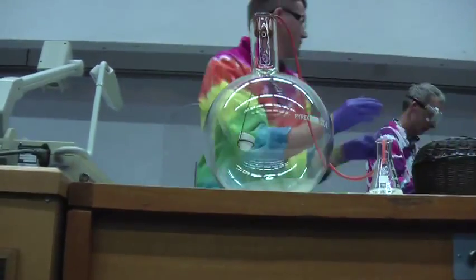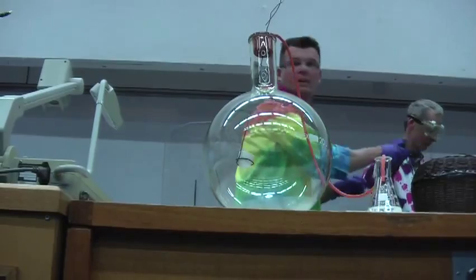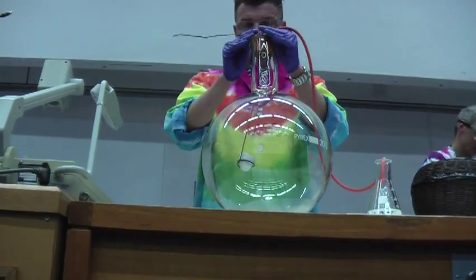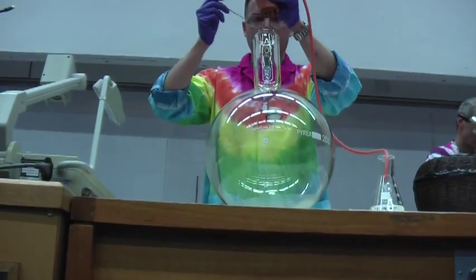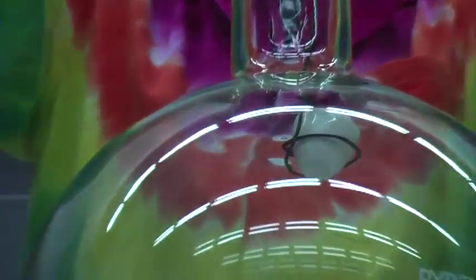We're ready on the lights. We've got an exhaust pipe there ready. Stop coughing—we haven't started yet. Right, ready? Ready with the lights please. When it starts, we have the lights down. Three, two, one. Off it goes.